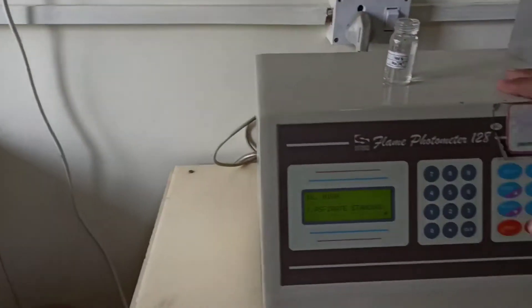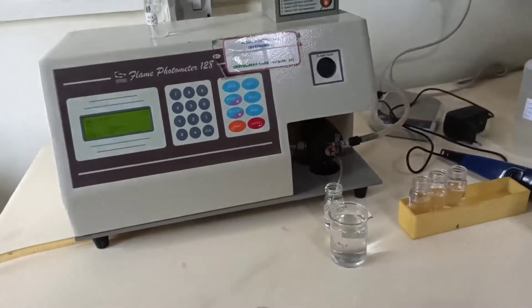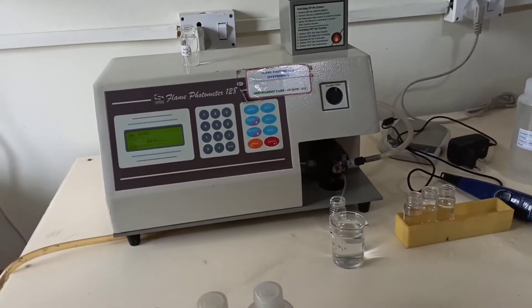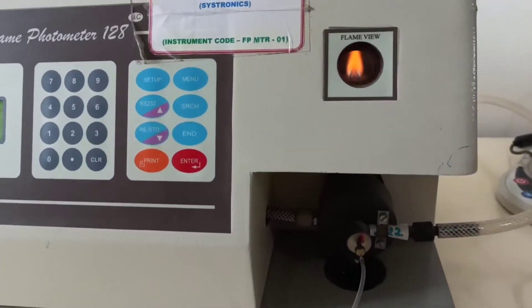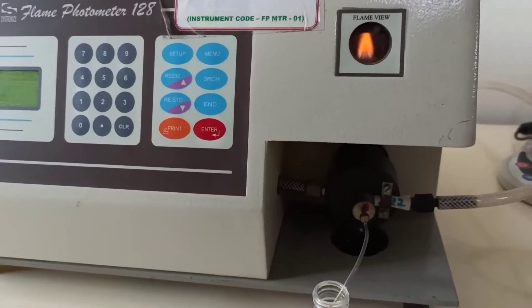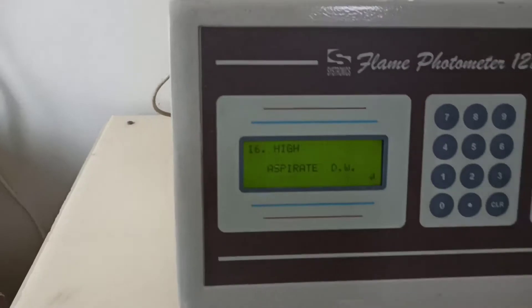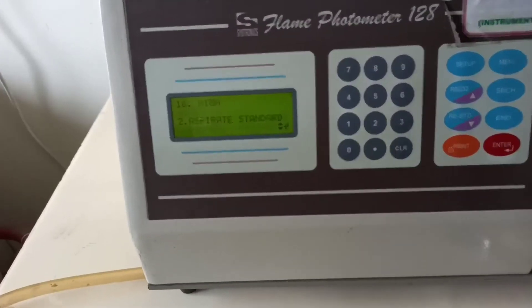This is the whole setup of the flame photometer. We are waiting for the second standard. It takes more time compared to ICP-MS, which is much faster. You can see the flame color — the concentration of sodium is high, giving a pale yellow color, and potassium at 20 shows a different high concentration and the flame intensity is high. Our photodetector detects this high concentration. Again, we aspirate with distilled water.